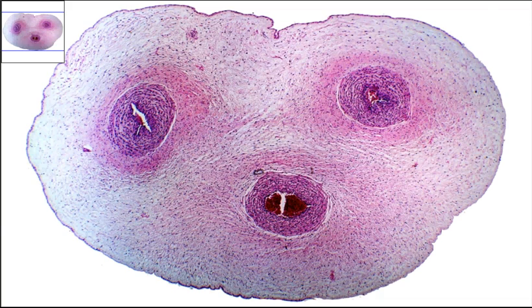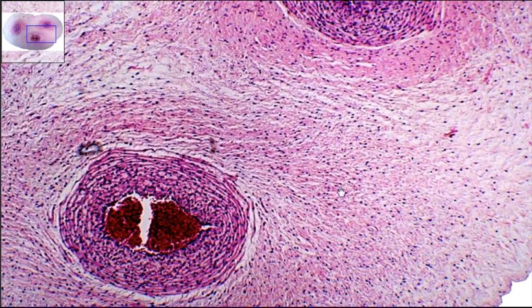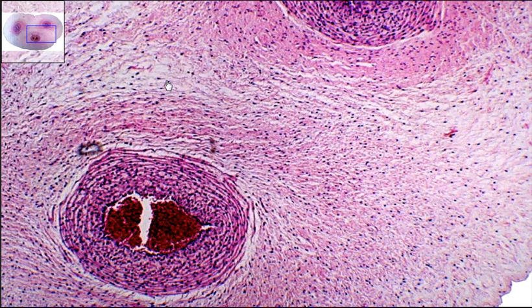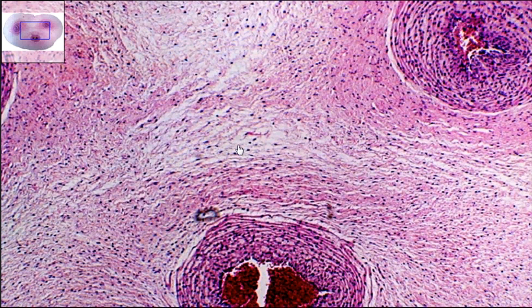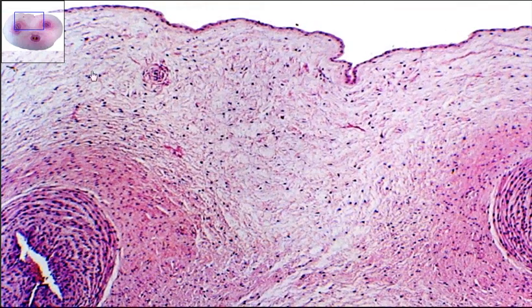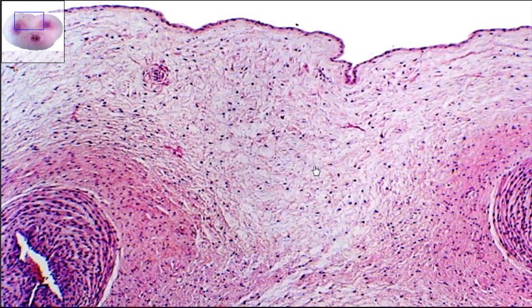If we zoom in a little bit, you can see the actual vein right here. What we're looking at and noticing is all these little dots. Each dark dot is going to be a nuclei of a cell. You can kind of see how there are lines running here — these are some of the fibers found in connective tissue. So all of these dots are cells, and you can see almost the fibers running. This is your embryonic mesenchyme found in the umbilical cord.